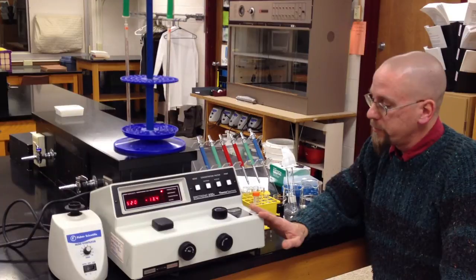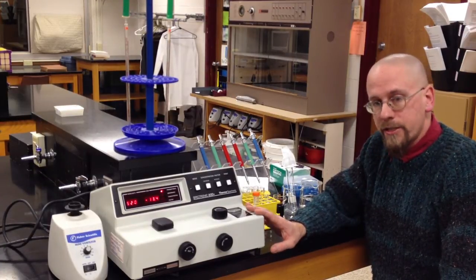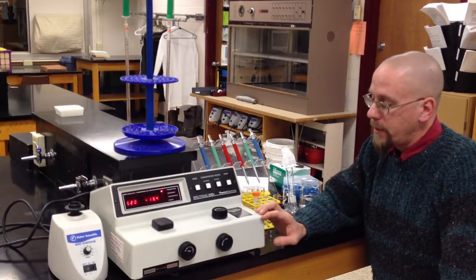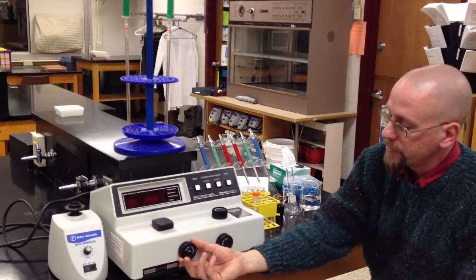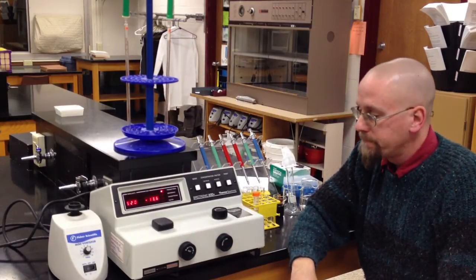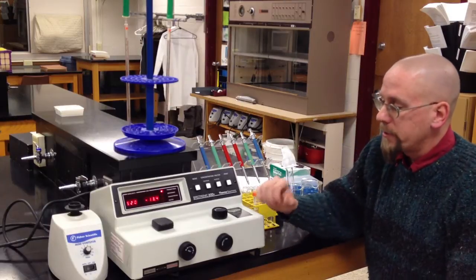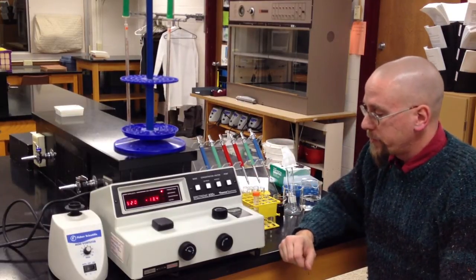What we'll do when we come in the lab, you'll start these up and go through a calibration sequence. You'll turn it on, let it warm up if it has not already, and follow the directions. It's printed right on the front of the spec, but we'll go through this very quickly.